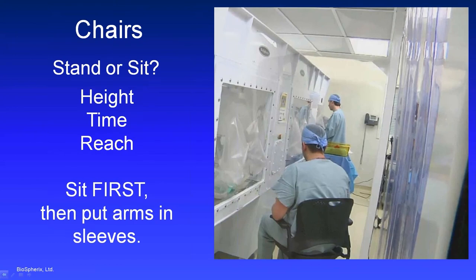Let's talk about chairs for a minute. Now, every person has a different body shape and size, obviously, and so different people are going to be comfortable working at the Xvivo system in different ways. Tall people tend to be a lot more comfortable sitting down, to get your arms closer to that work surface. And sometimes shorter people are more comfortable standing, particularly if they have to do a lot of reaching into incubation chambers or reaching into neighboring buffer chambers.